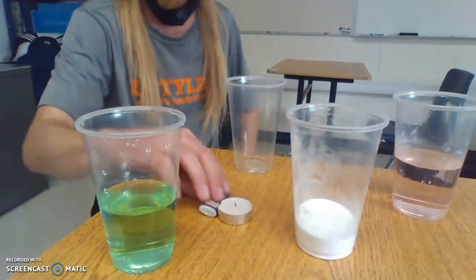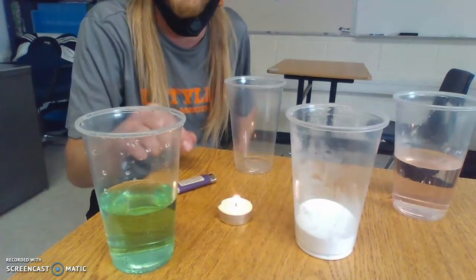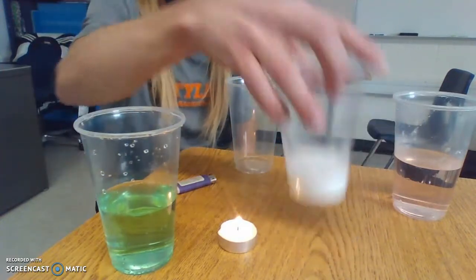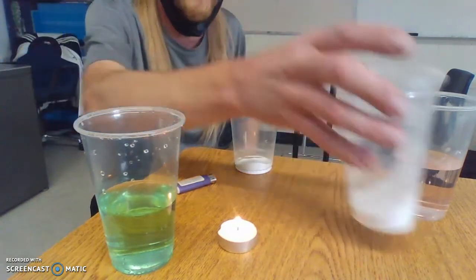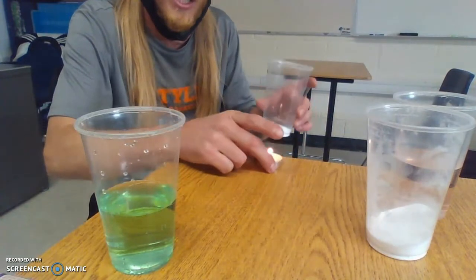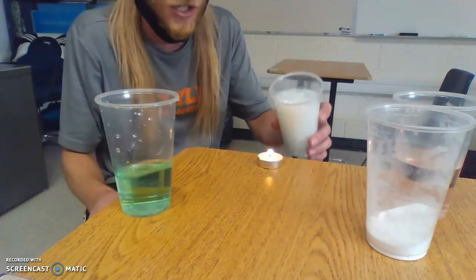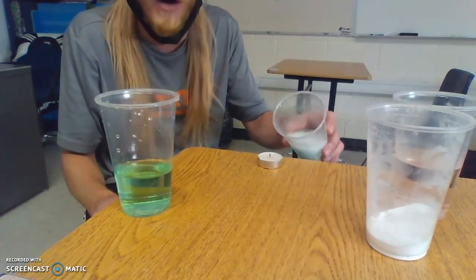So for you guys at home, the task was I lit a candle, and we had to make the candle go out using a gas that we produced. What the students in class found out was that if I mix this sodium bicarbonate, which is just a fancy word for the baking soda, and I'm going to move this to the edge of the table because it's easier, and then I mix in our vinegar, we're going to produce a reaction, and I can actually use this gas to make our candle go out.